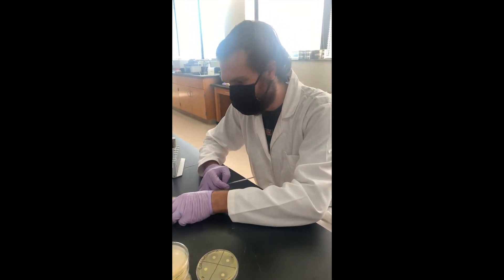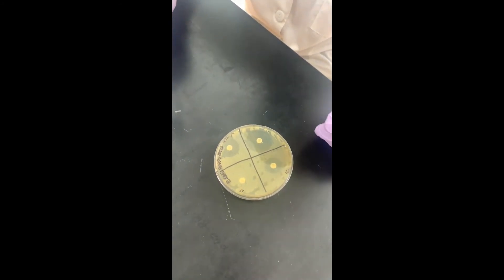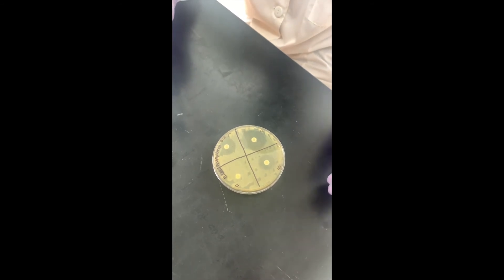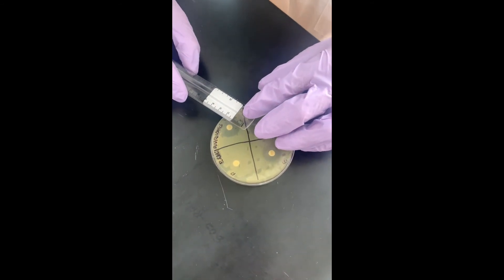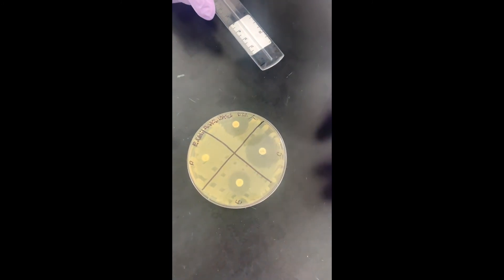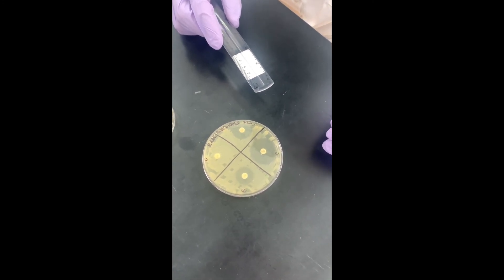One other thing to note: on this plate, the zone of inhibition actually goes off the edge of the plate. So how would you measure the diameter here? What you would do is measure to the center of the disc, which gives you the radius of the zone of inhibition, and then multiply that by two to get the diameter.